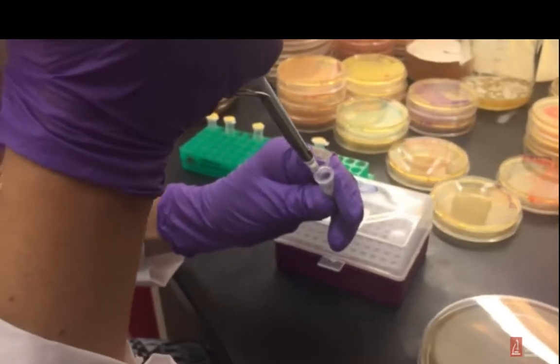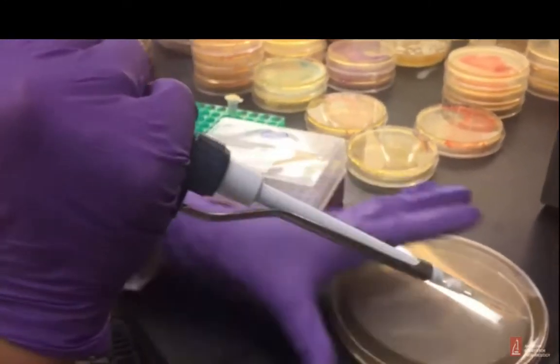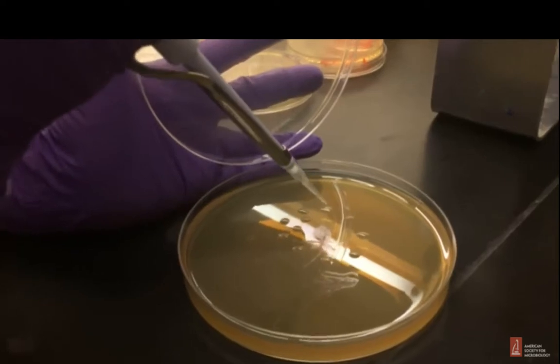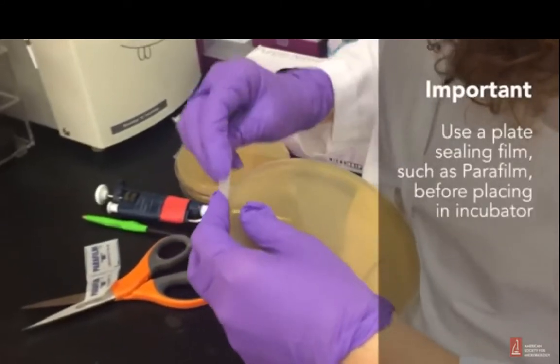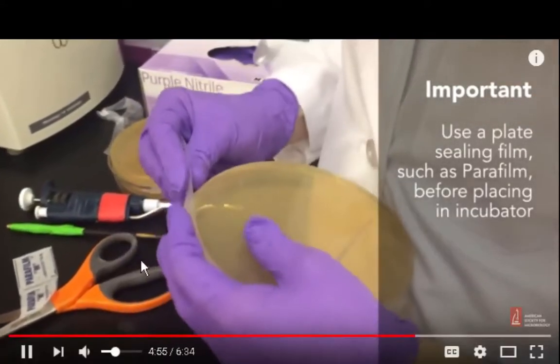Take a little bit of that. Now that's the tool I need right there, because I've got all those pipettes. Oh, look what she's doing. And that will be it. So now I have to let it dry for a little bit. Parafilm. Okay, now that's what I was looking for.